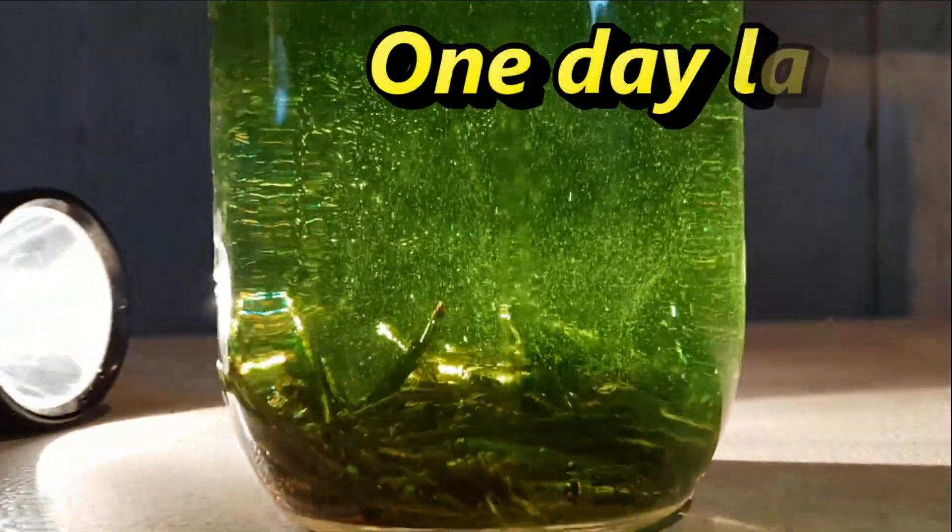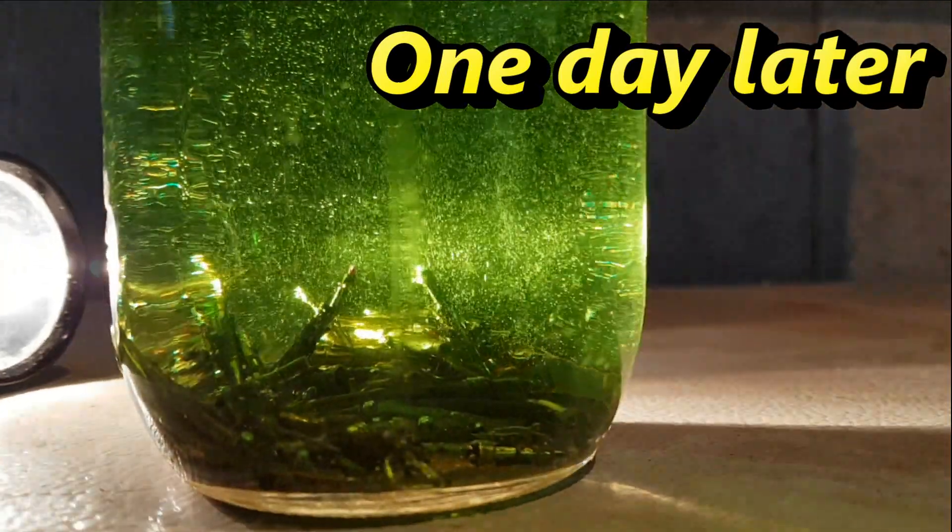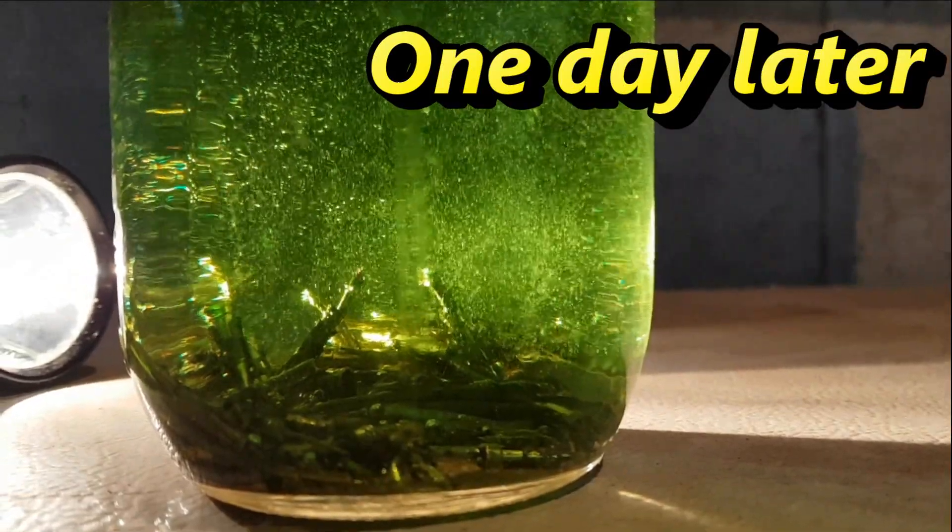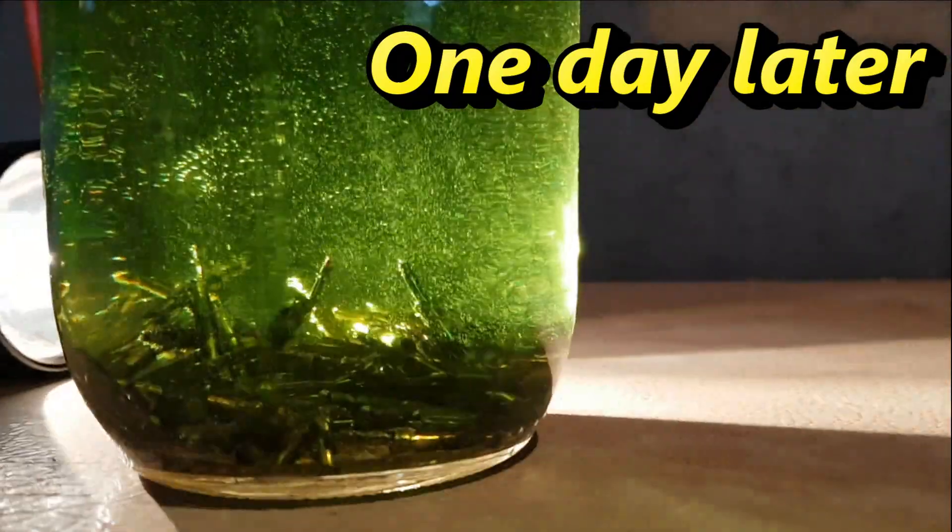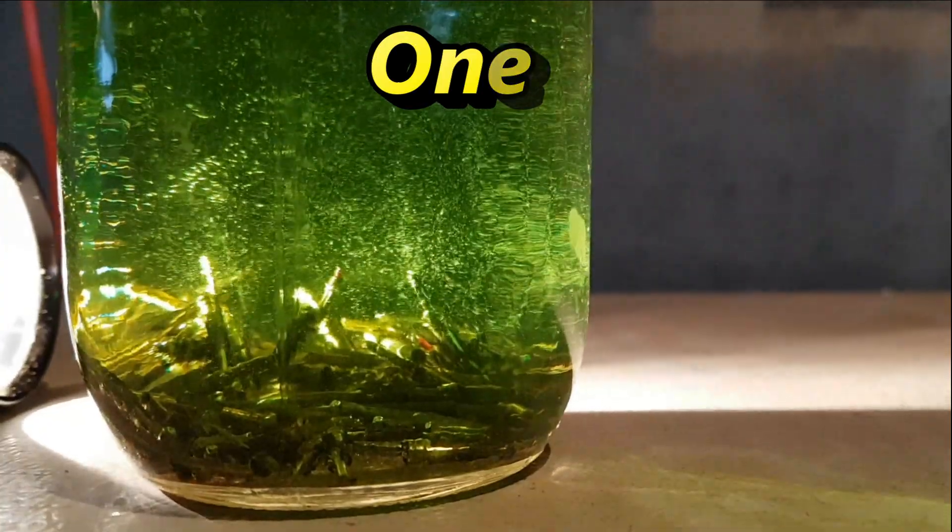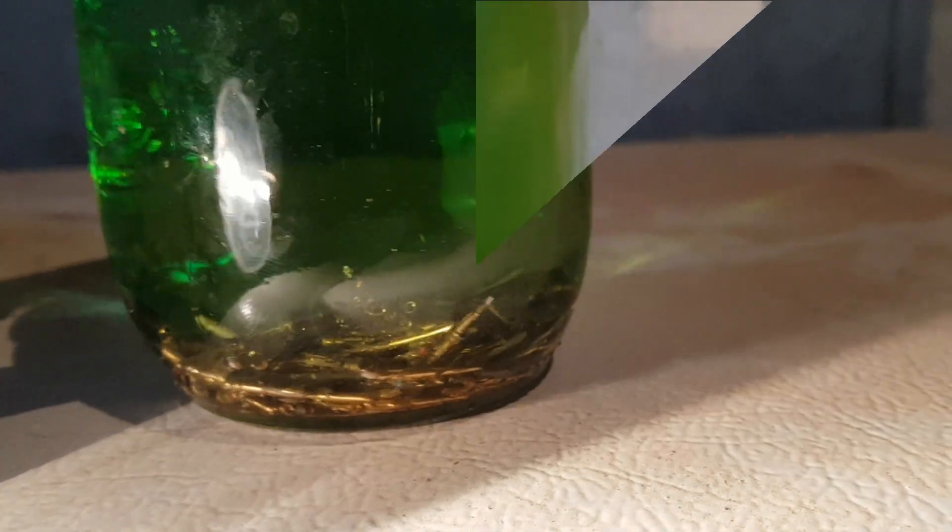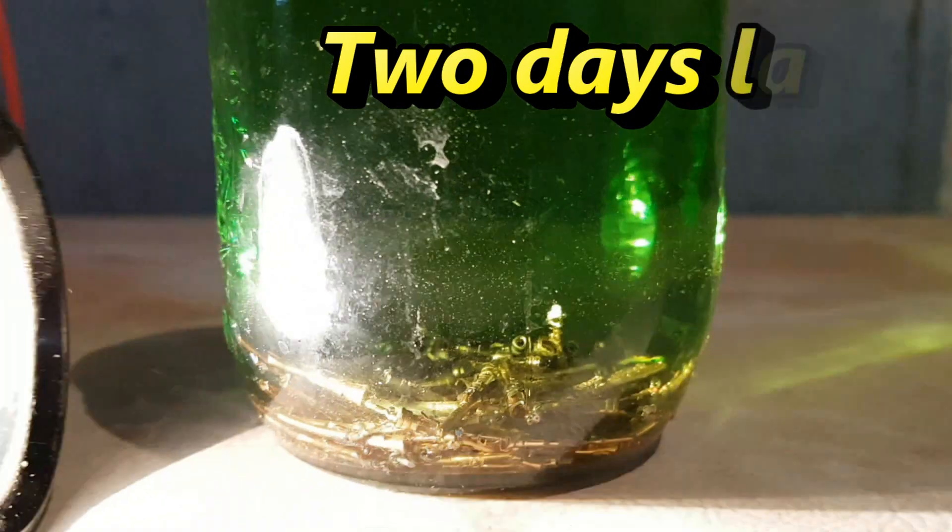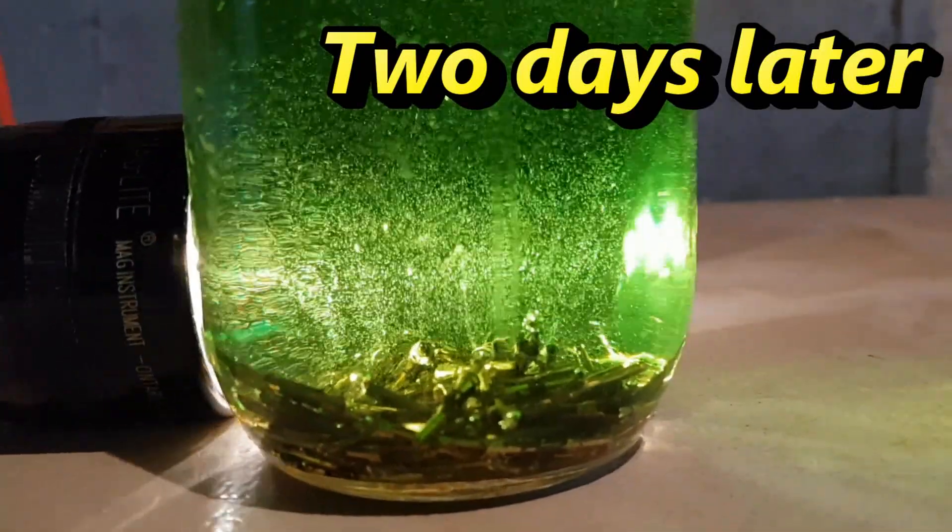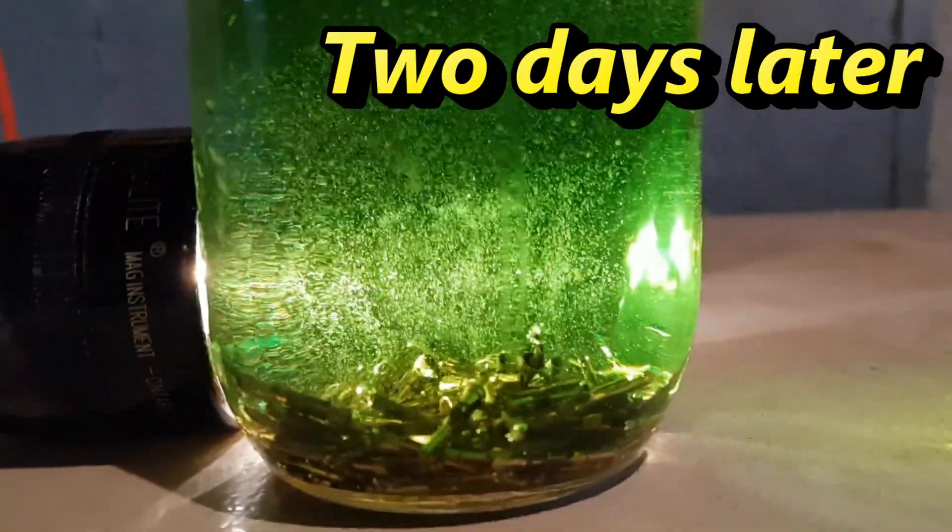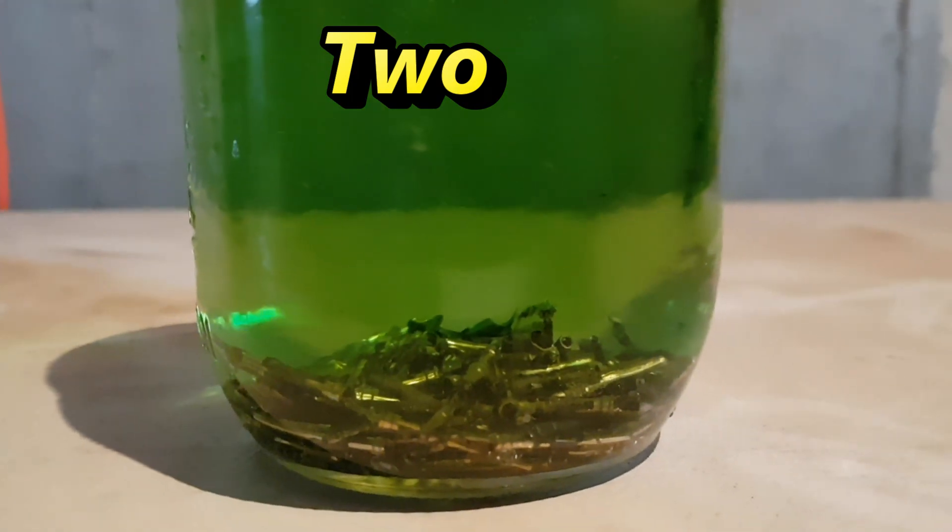Well we're back one day later and you can see there's still lots of bubbles being formed and there's lots of material left to be eaten by the acid. So this is a waiting game and patience is a virtue. We'll take a look back and see how it looks tomorrow. Here we are again two days later now and not a lot has changed. We're still seeing a lot of bubbles coming up but there's a fair amount of material left to be absorbed, but we are seeing more of the gold flake being carried up by the bubbles into the solution. So that is very encouraging.